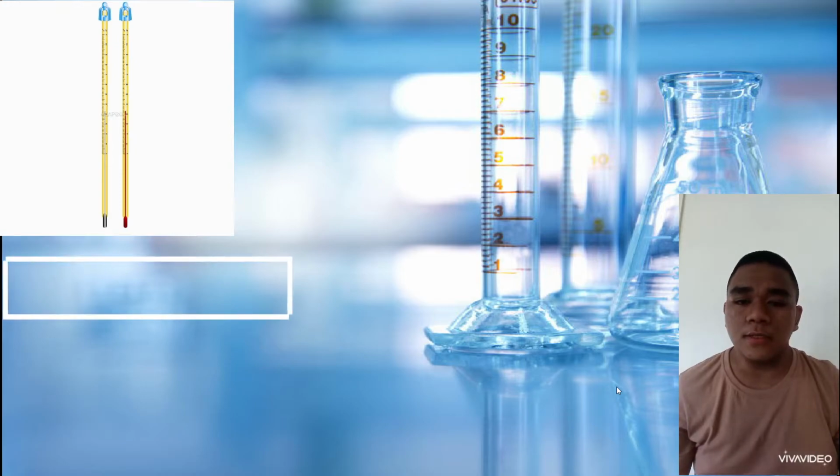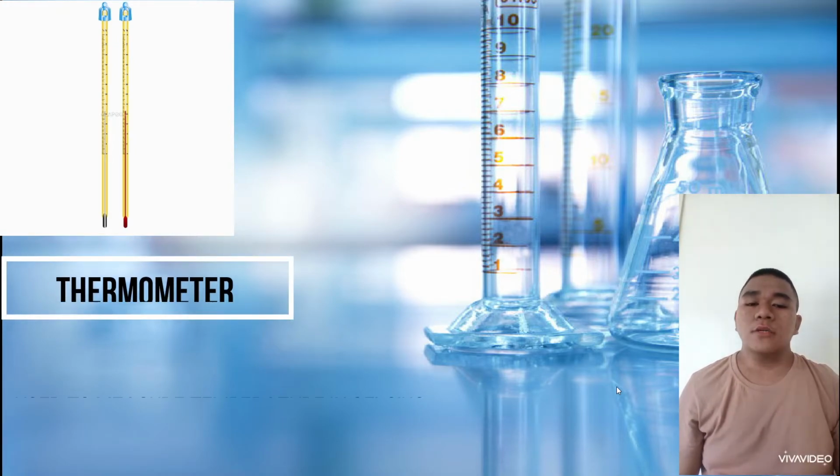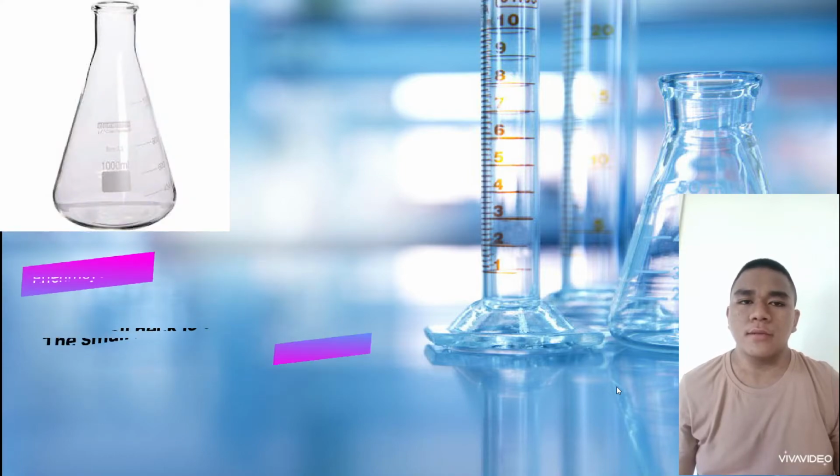Thermometer. Thermometer is used for measuring temperature. The function of thermometer is to check the boiling point and the freezing point of an object or the temperature of other substances. The range of a laboratory thermometer is between -10 degrees Celsius to 110 degrees Celsius.